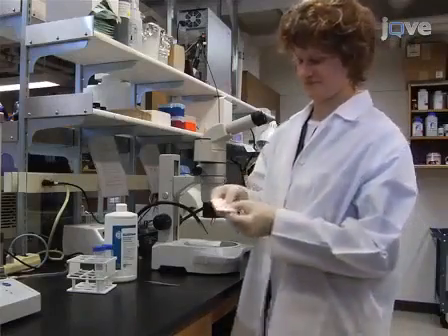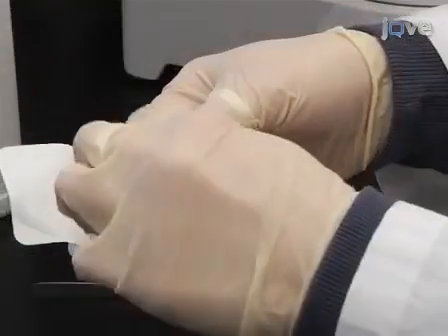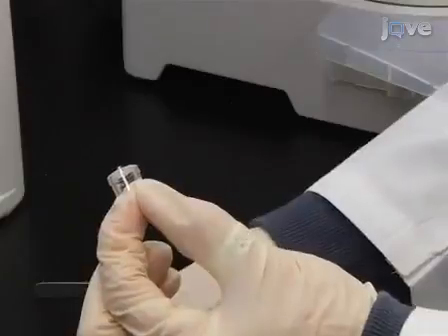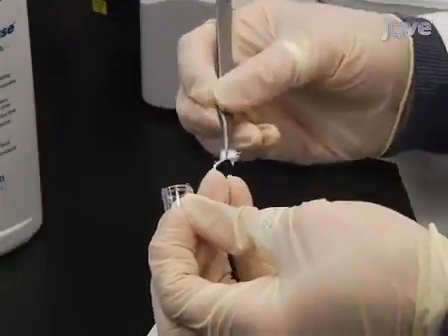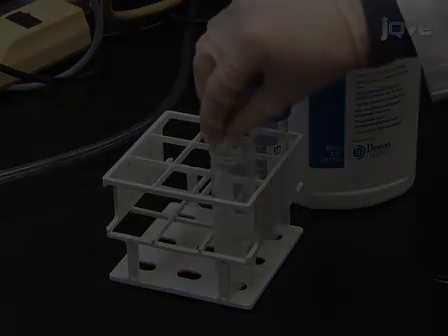At least one day before preparing the tissue, remove and discard the membrane from a 12 mm diameter millicell culture plate well insert. The remaining ring will function as a mold. Soak the rings overnight.